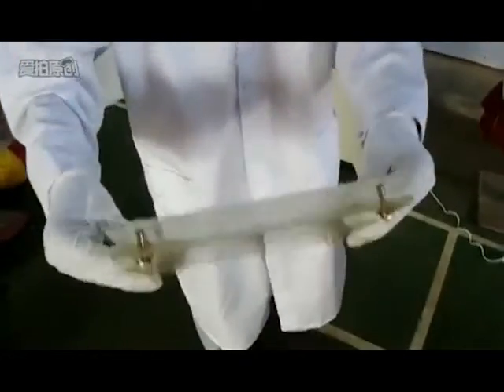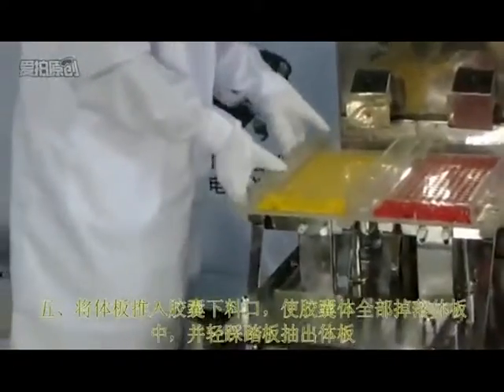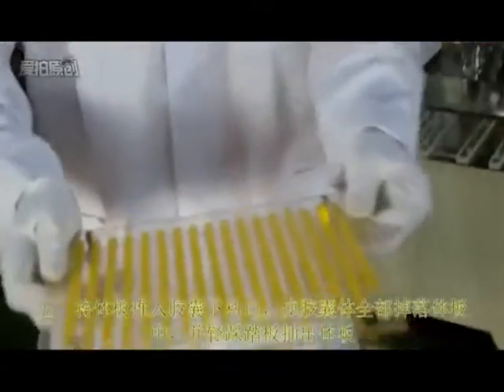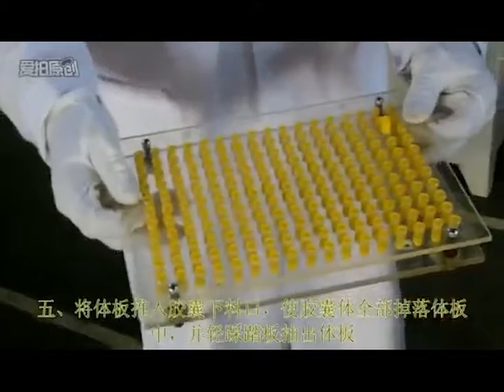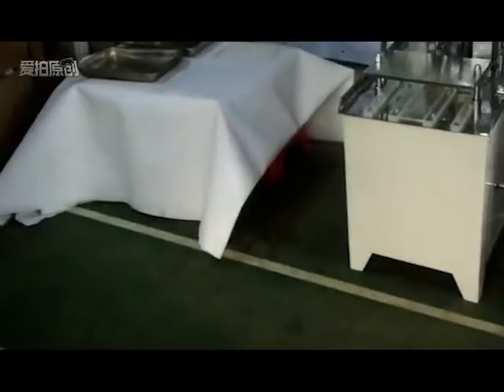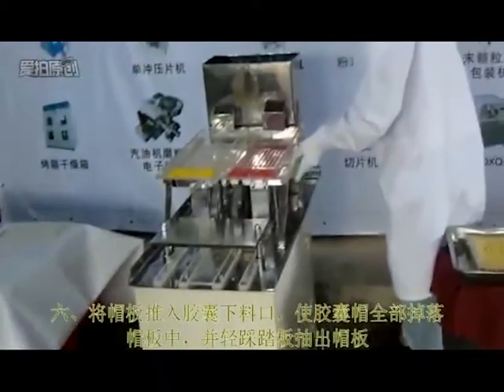After filling is finished, transfer the capsule into the installation mold. Then transfer the capsule cap into the capsule cap installation mold.